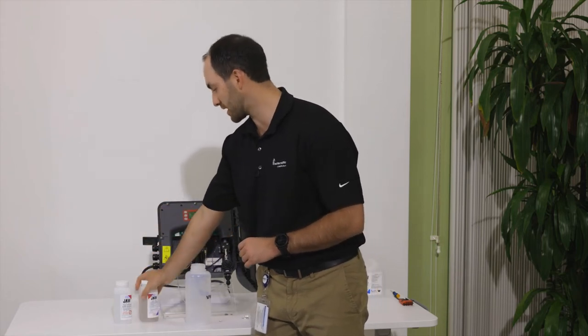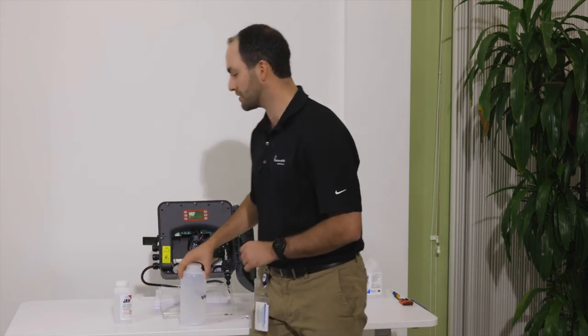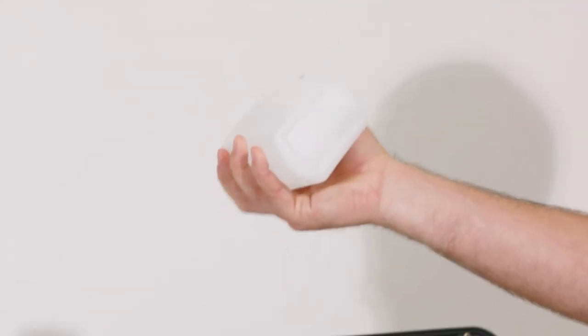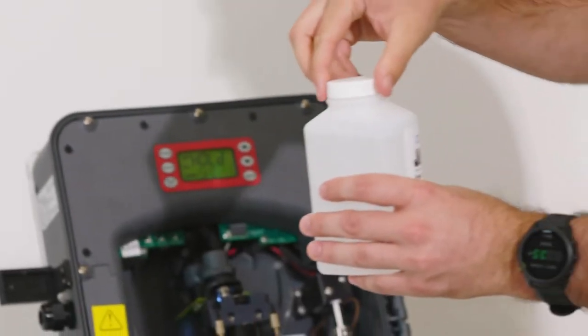So again, leave it sit about 30 seconds. While we're doing that, we can come back over to our buffer solution. We can look in the bottom and see, okay, everything is dissolved. We're ready to go ahead and hook this back up.